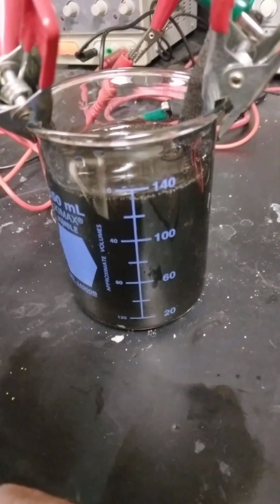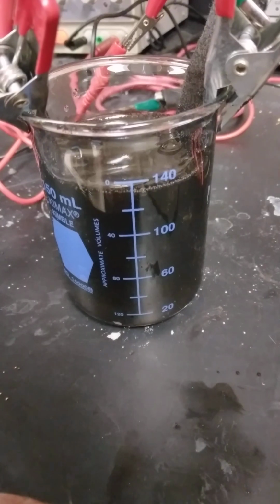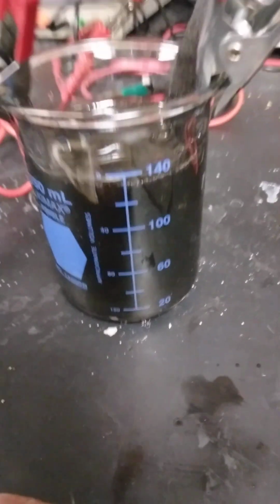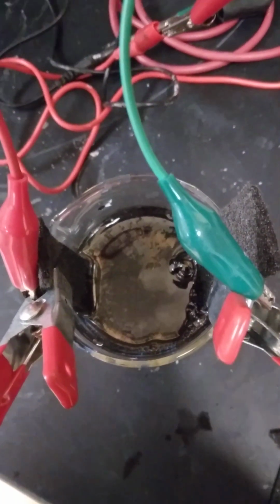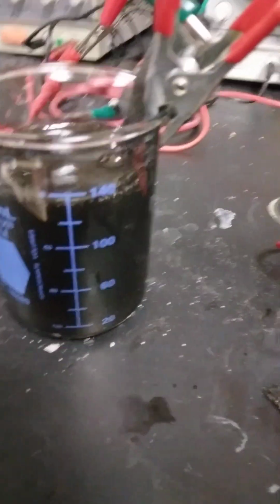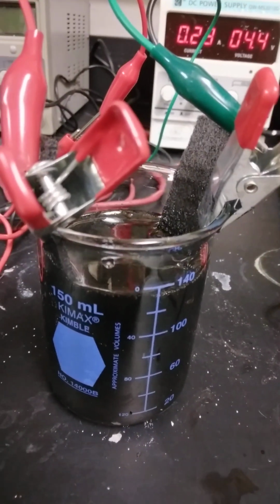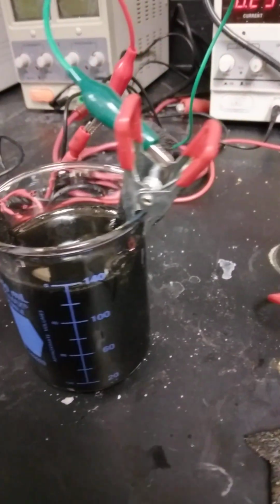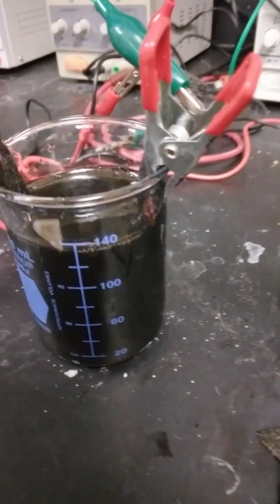And I put them right in there with aqueous sodium hydroxide. It's about 2 molar sodium hydroxide. And gas evolution was taking place right away. Made no attempt to collect the gases at this point. Just want to see if electrolysis is occurring. Obviously, you can see without baking, pyrolyzing, you're getting some of the material coming off of the surface of the graphite pads. I get these from Amazon, but you can see the gas evolution.